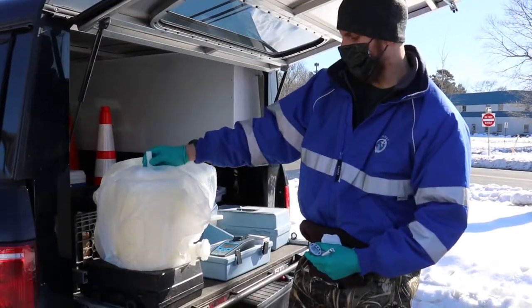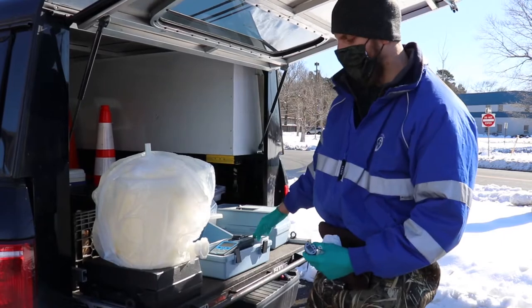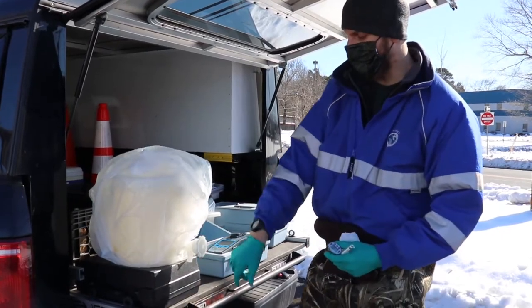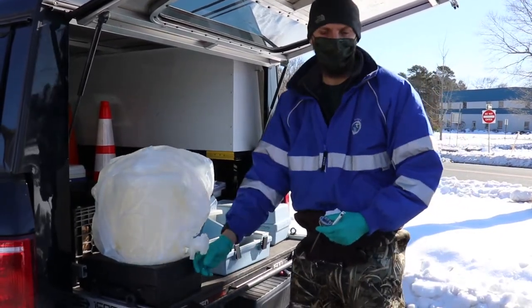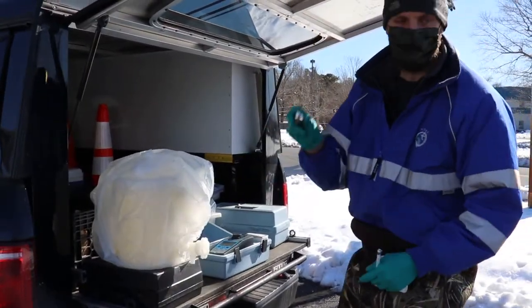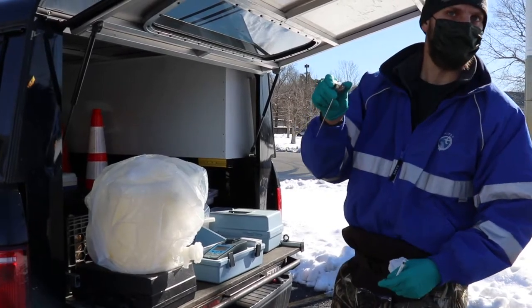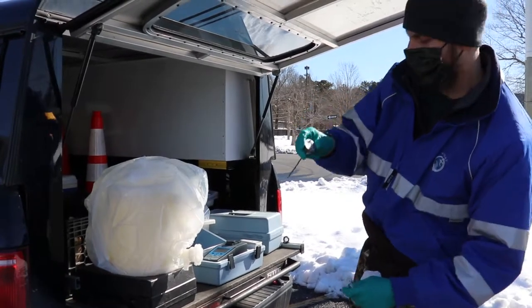While doing that ten times, I'll take a vial out and I'll spin it and collect some water. While I'm taking turbidity measurements, you're multitasking too — making sure to take an air temp while you're at the site.